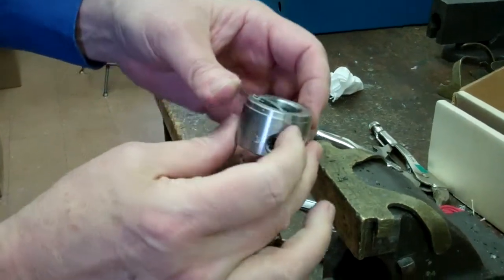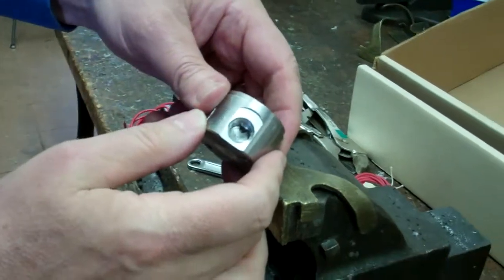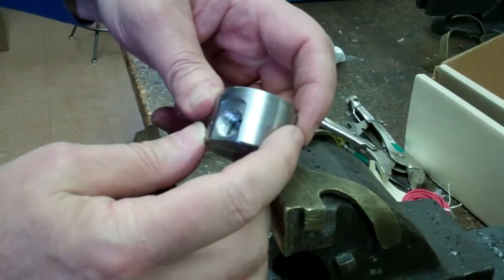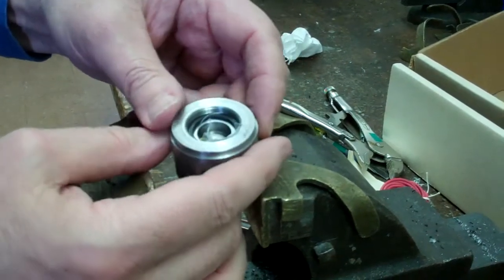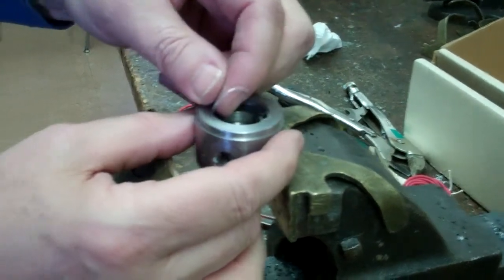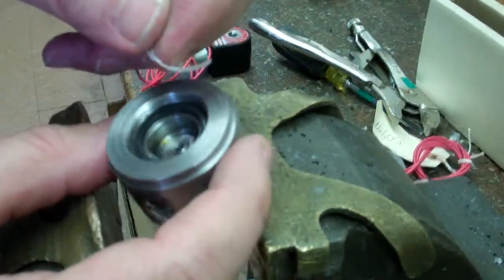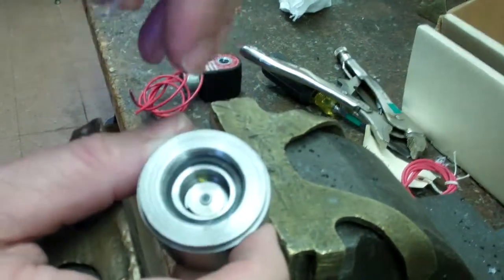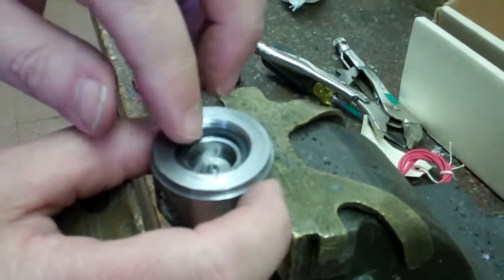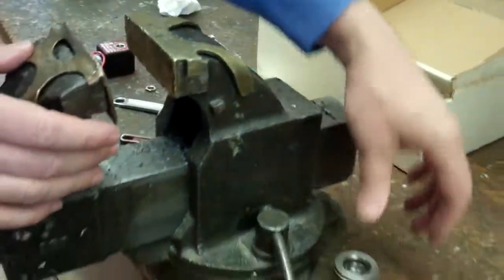And I'm trying to look to see if there's something. There's no clear indication that I can say for sure something flowed through there and got inside, but this is really suspicious. Finding this and finding the stuck plunger and that little piece of yellow material. I think something got put through this valve and caused the valve to lock up.